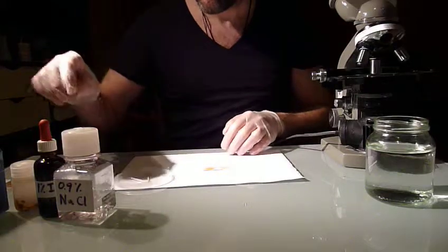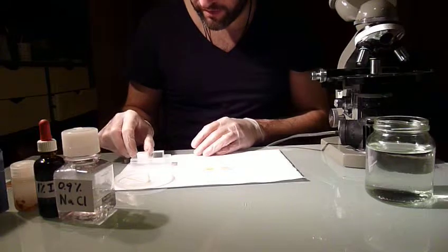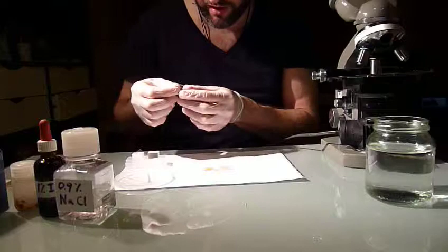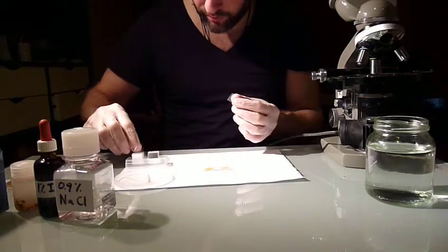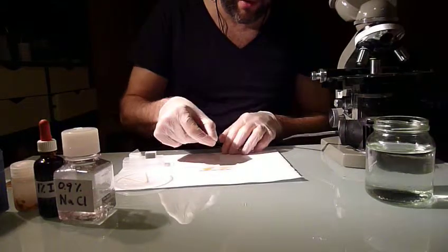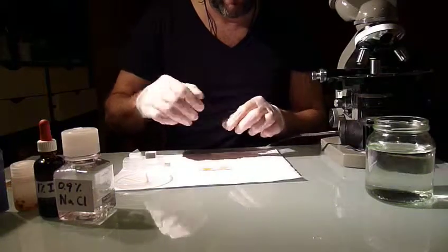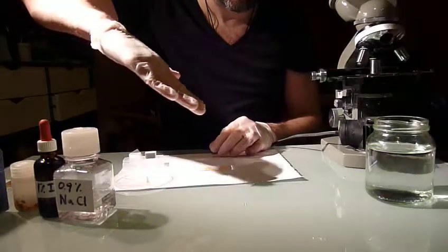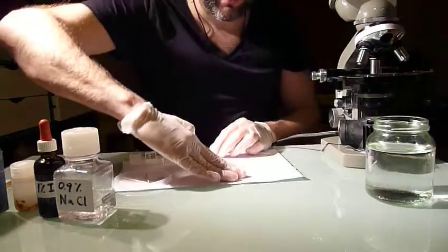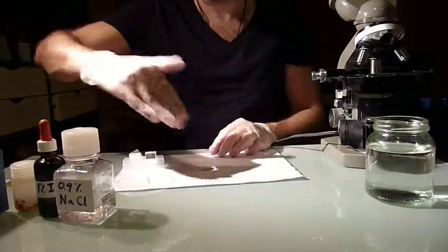So you have that. Then you take your cover slips. Be careful with these, they are very thin and fragile and not too easy to handle with gloves always. And what you want to do is you want to place these on top of your drop, but you want to make sure you don't get too many air bubbles in it, and the easiest technique for that is just putting it down like that and then slowly letting it sink flat, and this way any air will just roll out.